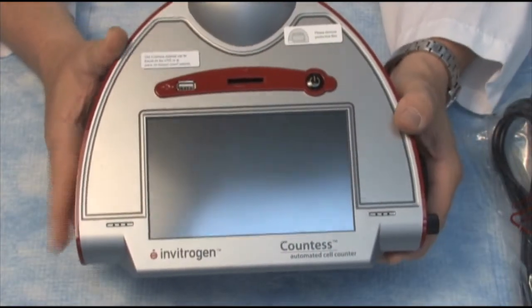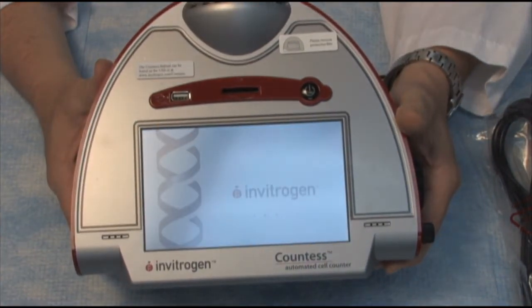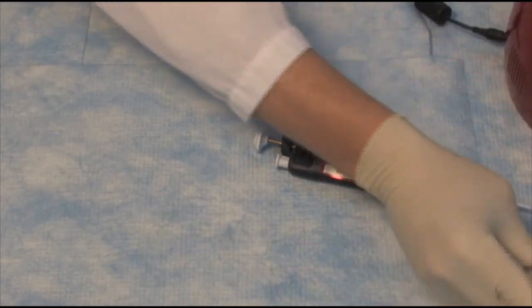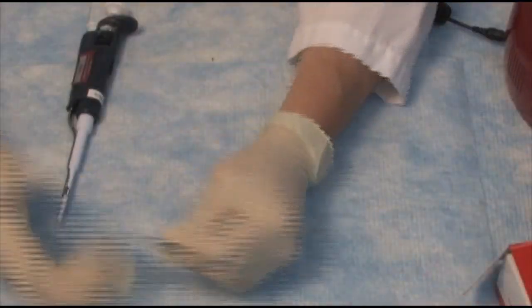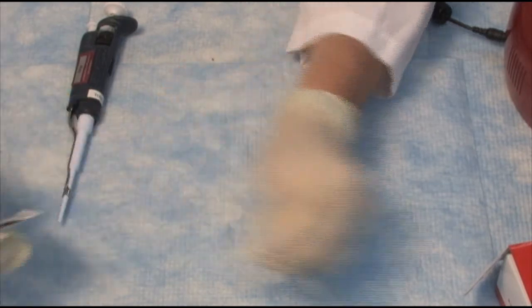I'll press the on button. So I'm going to set this aside for a moment as we load the cells, as we're going to use one of these cell counting chamber slides that comes with the kit.